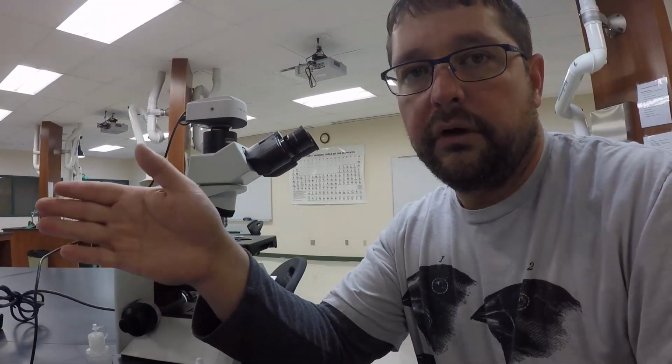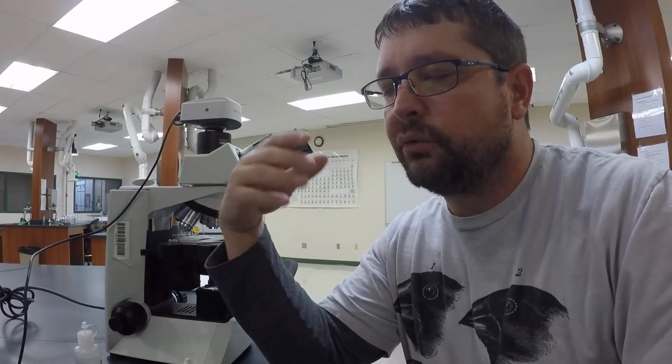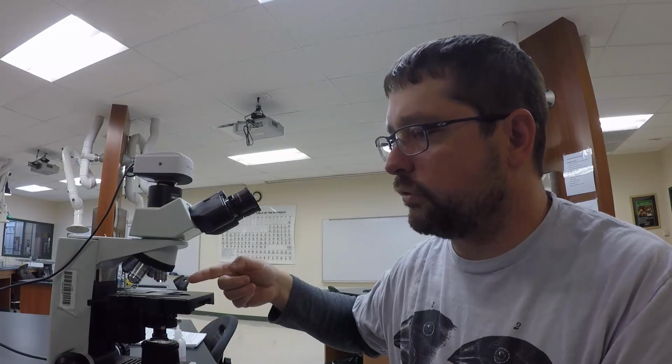Now what I'm going to show you, through the connection from the camera to the computer, is the particles in motion, called the Brownian movement. Often when we talk about biology and chemistry, we say particles are always moving. Even the particles in the desk, in the computer, in the camera or the microscope, in our bodies, are always in movement. The movement might be very minute, but they're still moving. This is one way we can show you that. You can see these individual particles of Indian ink, and as the light source increases the temperature of the slide, the movement of these particles should speed up.